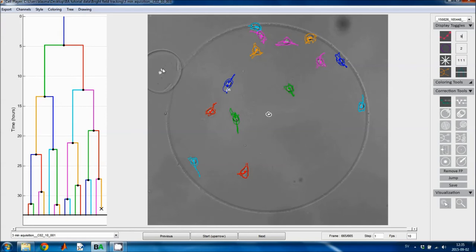These white regions here are false positive objects or false positive tracks, which were detected by the segmentation algorithm but not included in any cell tracks. These regions have been linked to nearby regions, so it's easy to get these tracks back if the track linking algorithm missed a true cell track and made it a false positive track. And if we had just deleted these objects, it would take a lot of time to draw outlines manually for all of the frames that were missed. You can, however, toggle the display of these false positive objects on and off, and you can also select the color for the false positive objects.